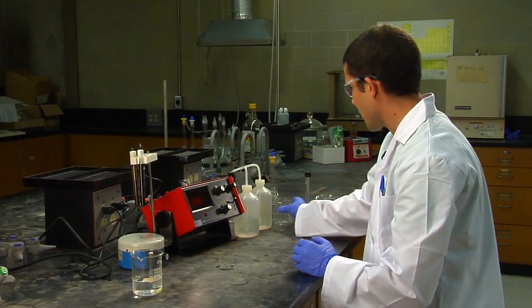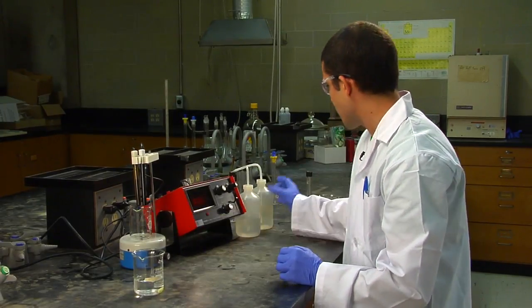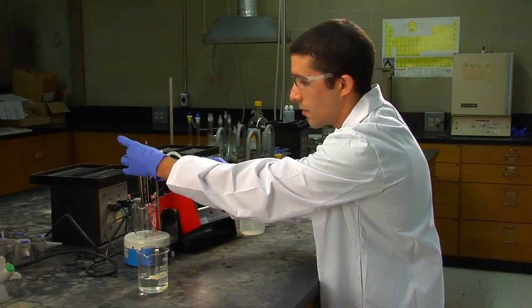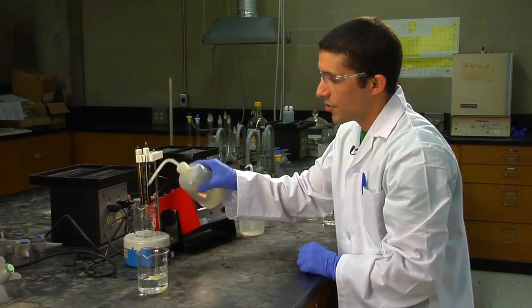You can remove the beaker, place a small waste beaker to rinse the electrodes. Just like this.